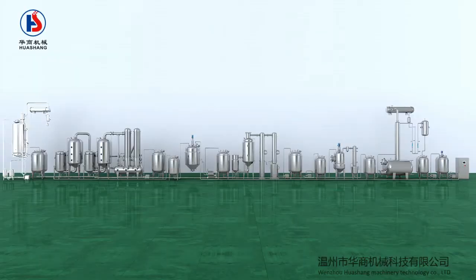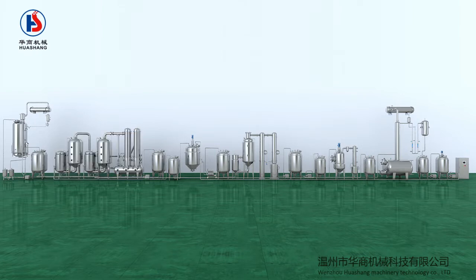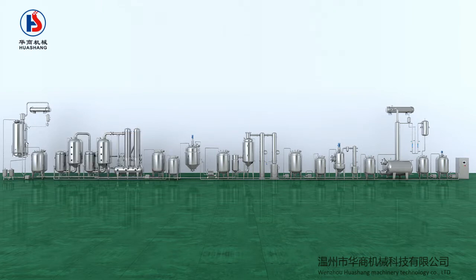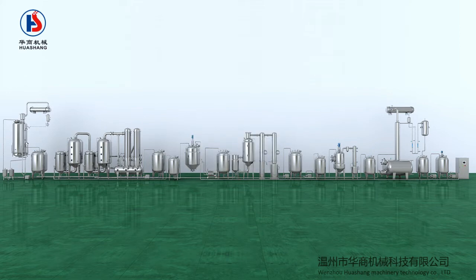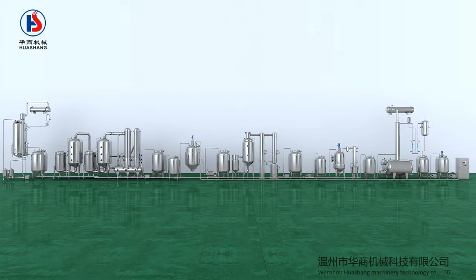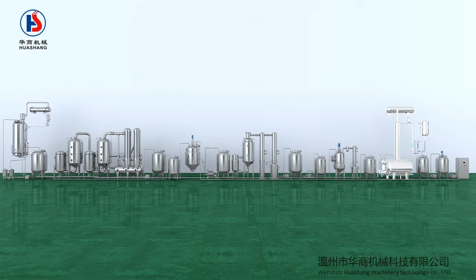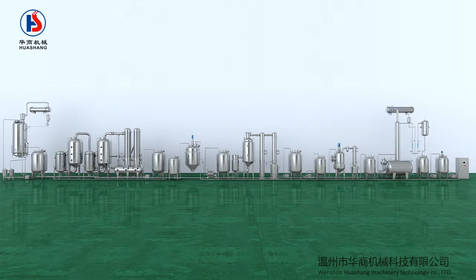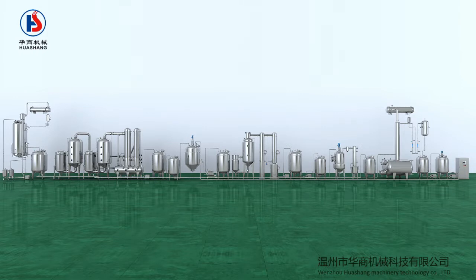The production line includes multifunctional extraction tank, liquid extracting tank, concentration equipment, condensate tank, concentrated liquid tank, alcohol sedimentation tank, supernatant tank, alcohol recovery concentrator, alcohol storage tank, alcohol distillation tower, concentrated liquid storage tank, alcohol preparation tank and pipes, valves, and automatic control system.